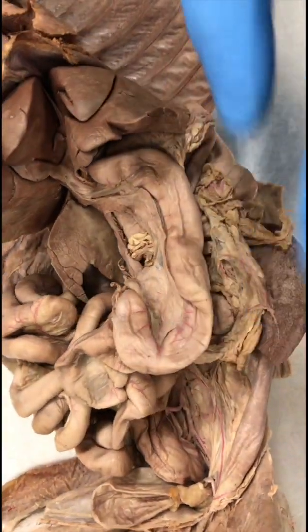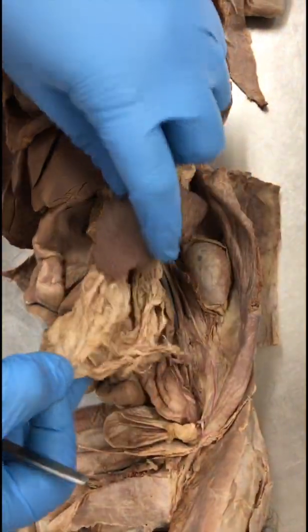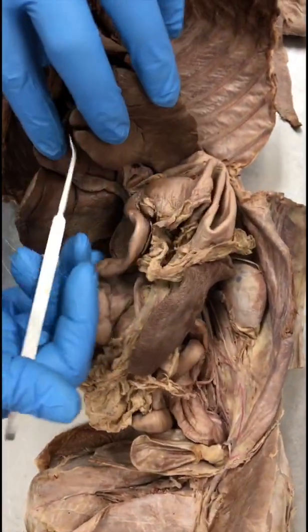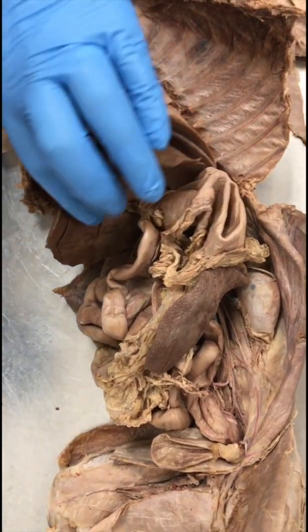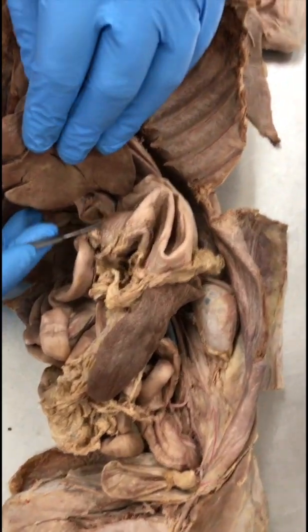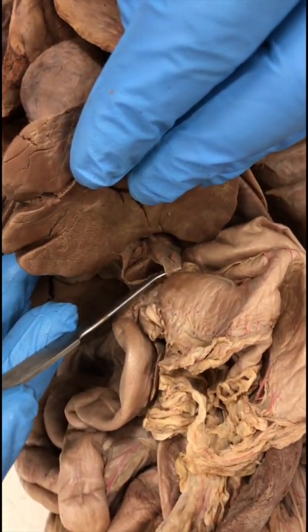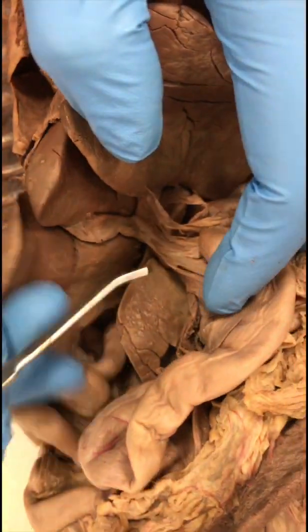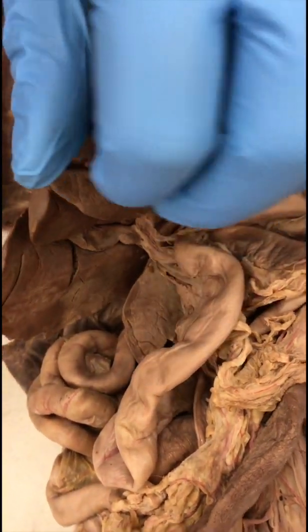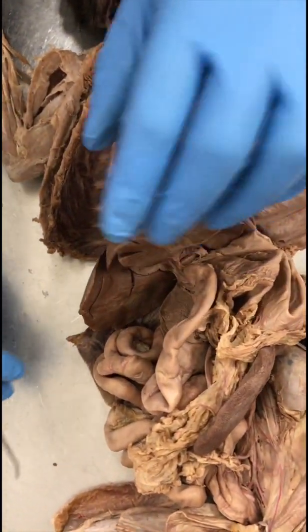Okay. Greater omentum. So that would be all these structures. This will be the greater omentum. The lesser would be at the base of the liver lobes here. But what you have to know about the lesser omentum is there are 2 ligaments. One that goes from the stomach to the liver. This part is the gastrohepatic ligament. And the other part that goes from the duodenum to the liver, this part is the hepatoduodenal ligament. So liver to stomach, gastrohepatic, liver to duodenum, hepatoduodenal.